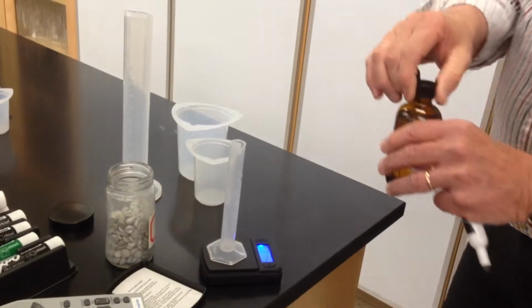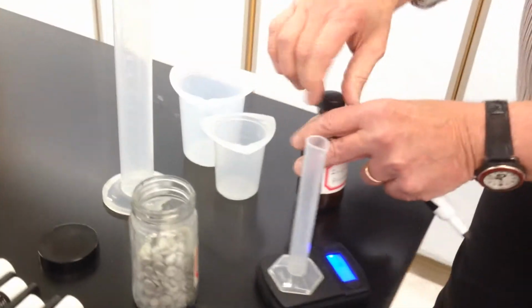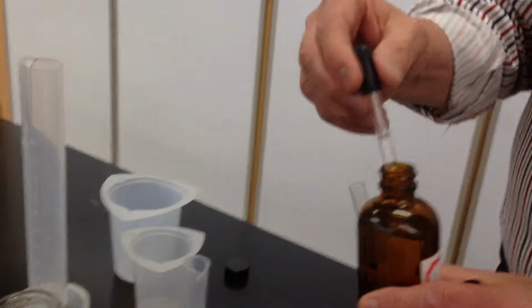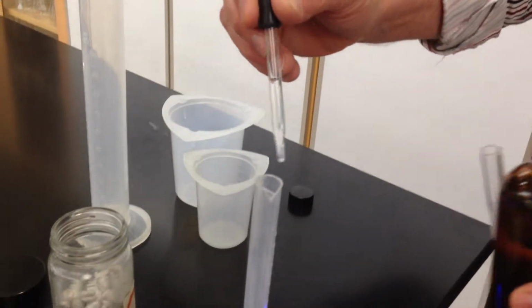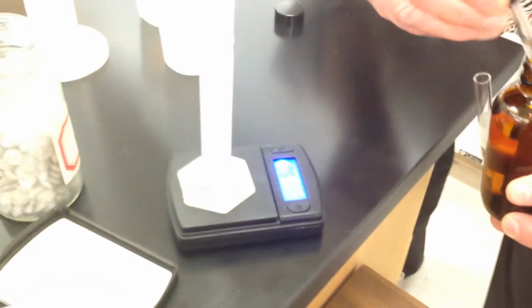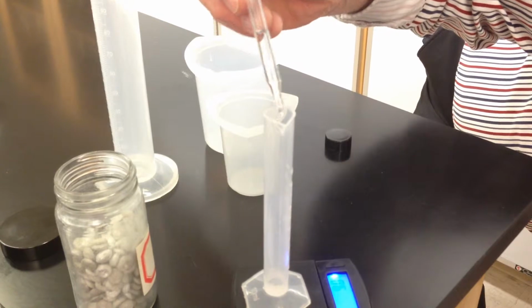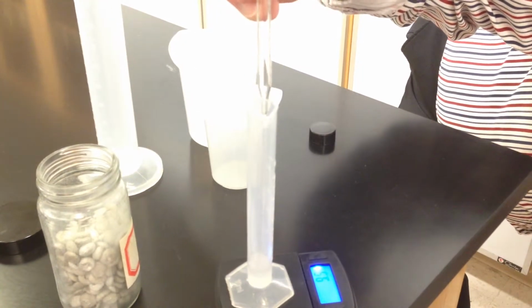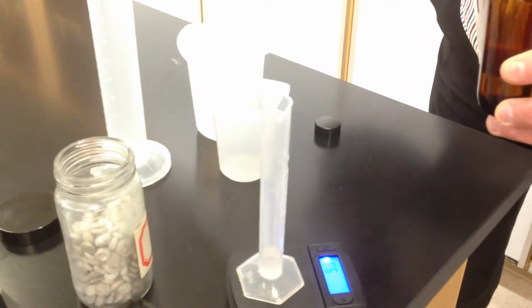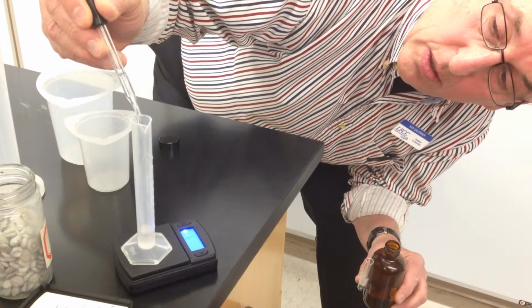All right, now I'm going to add rubbing alcohol, or isopropyl alcohol, or 2-propanol. And again, it doesn't matter how much volume you actually add. I'm going to make the math easier for me. I'm going to fill up to the 2 mL mark, but again, it does not matter how much you actually add, because obviously as you add more volume, the mass goes up too.